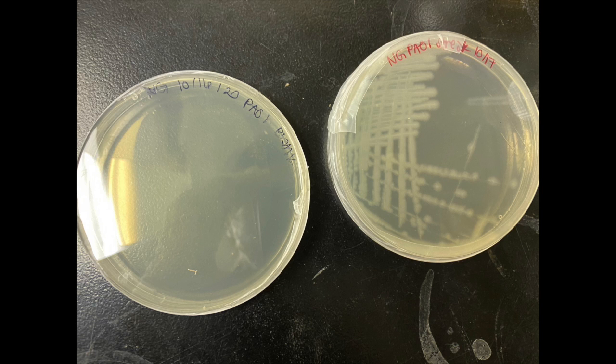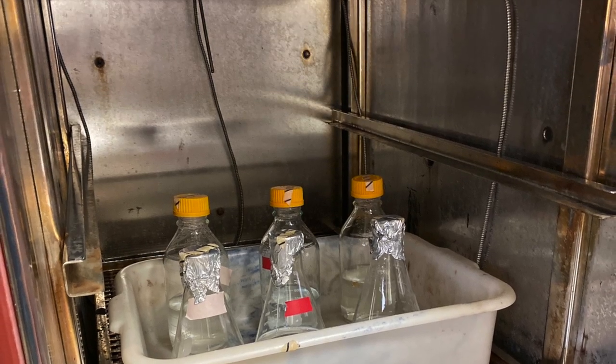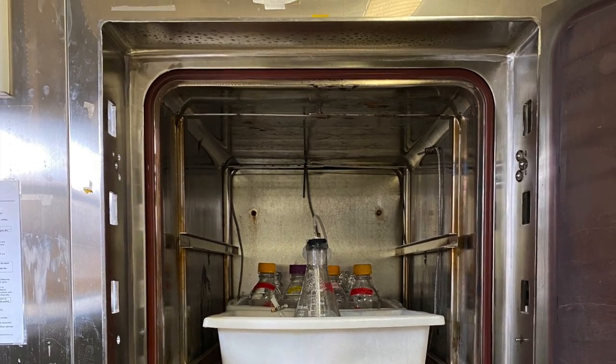While the autoclave is running, make a streak plate of the desired organism. In this case, it is Pseudomonas aeruginosa. After you've created your streak plate, you can leave it to sit in the 37C room to incubate for 24 hours. Once the autoclave has finished running, consolidate your MD media and remove your chemostat equipment with caution.